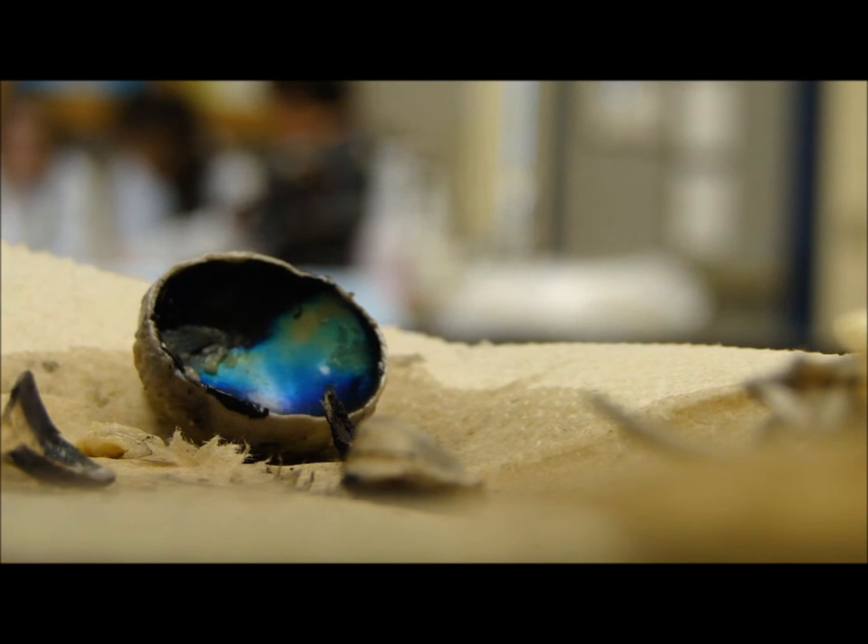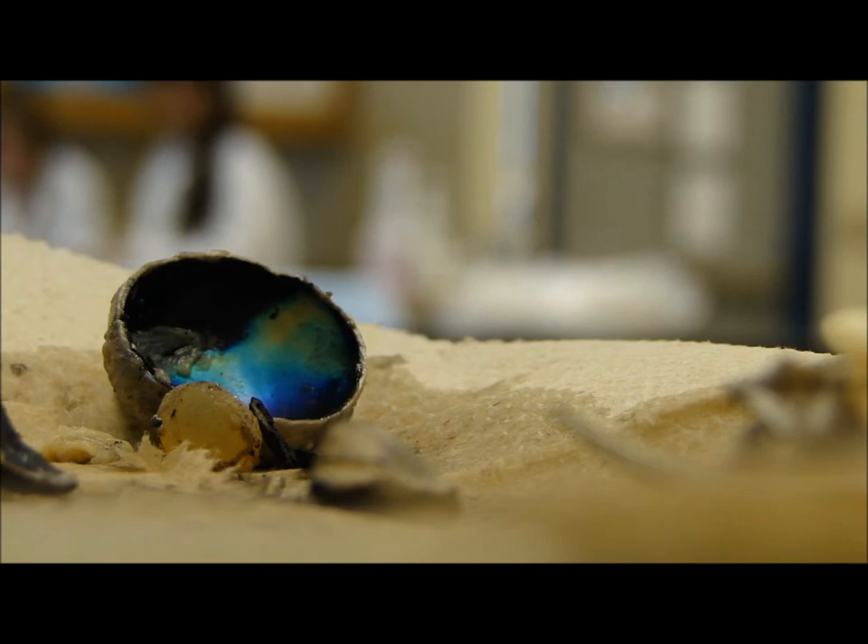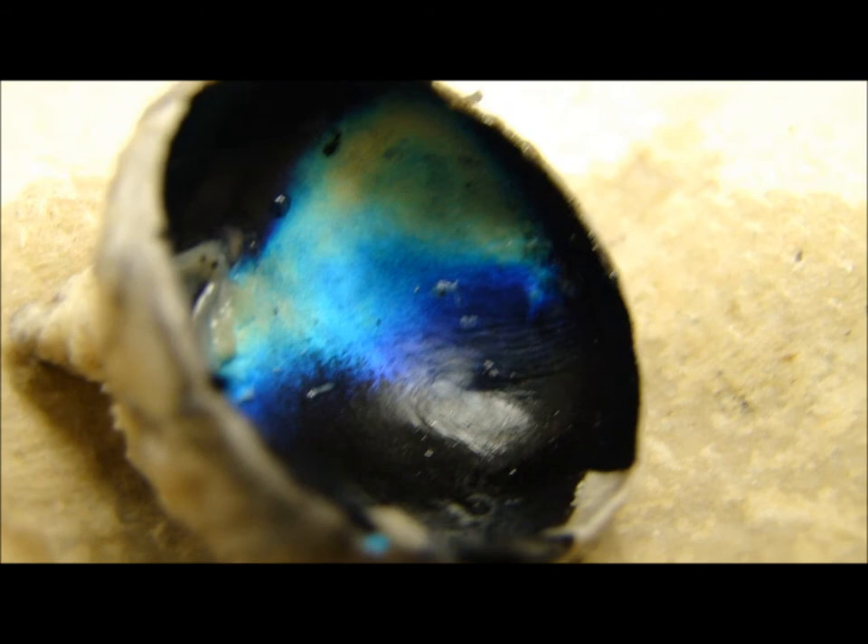Alright, we're done. Not really, we still need... Yeah, so we're done. We need to put all that stuff up first. I'll throw this away if you clean. Wait, let me get a close-up. Super close-up. Whoa, that looks pretty legit.